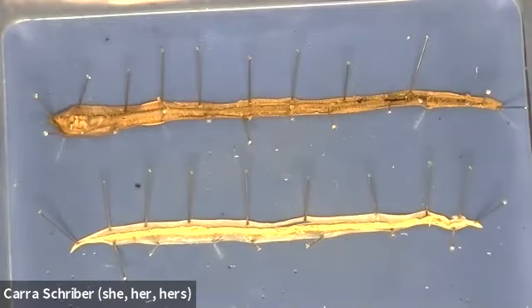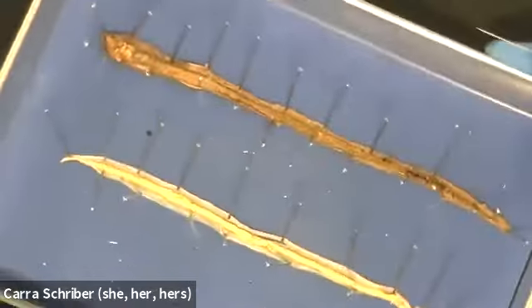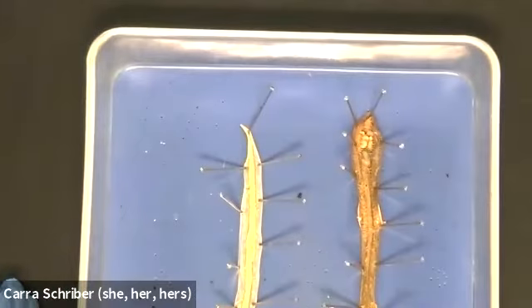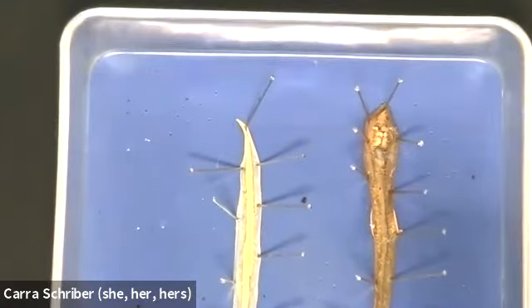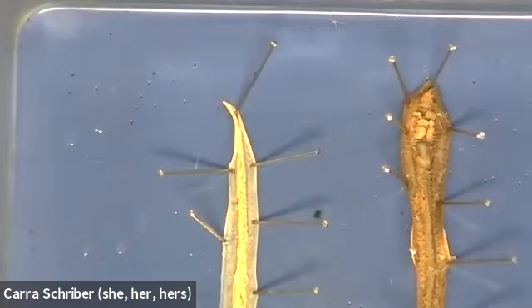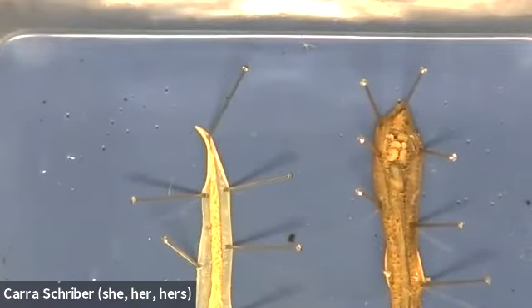I couldn't confirm it without looking at some of the stuff that we'll talk about here. So I thought we would start from the head region, and then we'll zoom in just a little bit. In, not out. All righty. Ceiling camera has a pretty good amount of zoom.